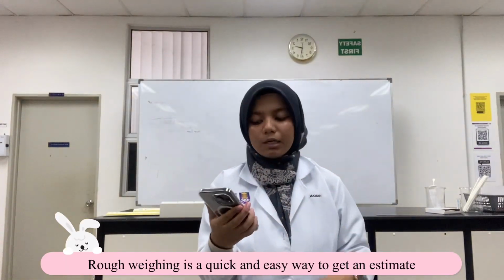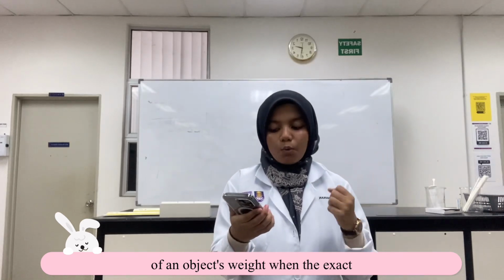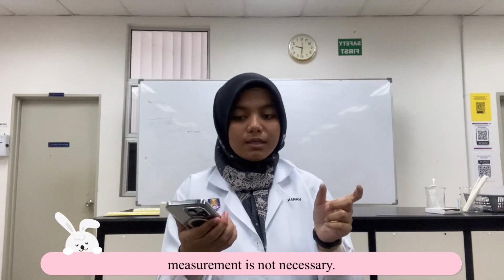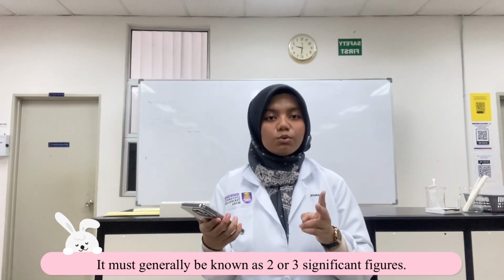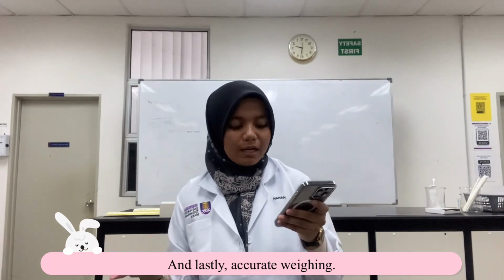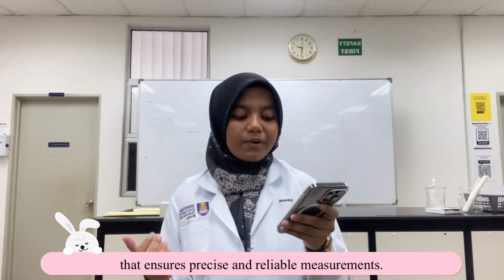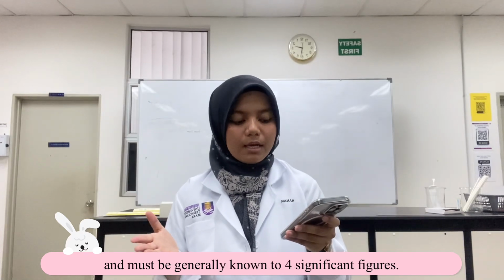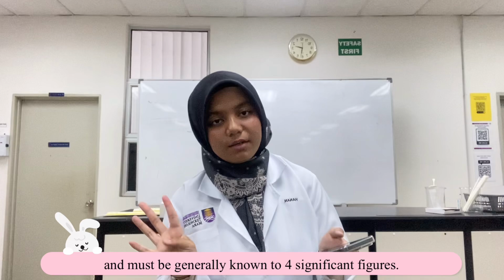Rough weighing is a quick and easy way to get an estimate of an object's weight when the exact measurement is not necessary. It must generally be known to 2 or 3 significant figures. And lastly, accurate weighing. Accurate weighing is a meticulous process that ensures precise and reliable measurements and must generally be known to 4 significant figures.